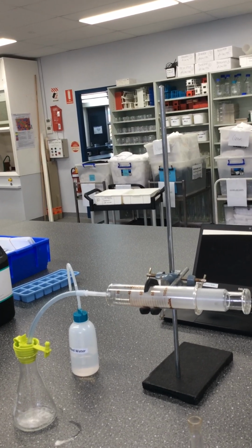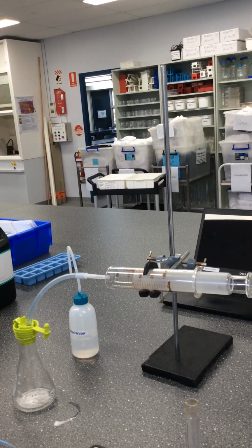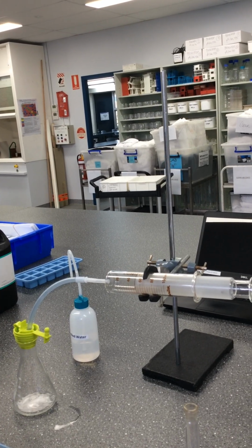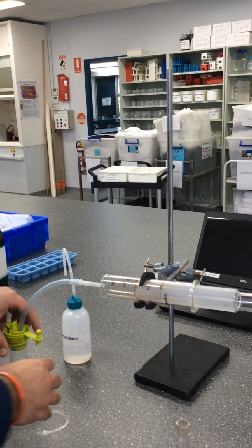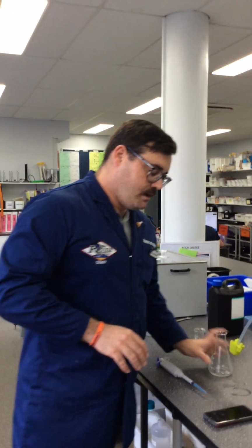We've got about 10 seconds left, roughly. Remember, we didn't do it that well. Okay, keeping everything the same as we did before for fairness. All right, and that is it. So we were at 44, 48, 52. All right, taking this off, and we dispose of that the same as we did, rinsing it again.